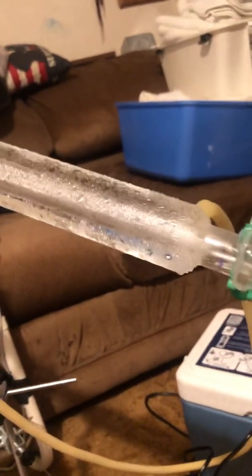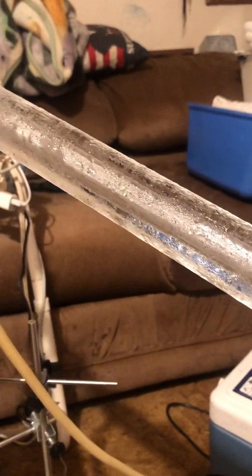This is what they call a Liebig condenser. It's basically a glass tube surrounded by another glass tube, encompassed in water, which basically just turns that steam — condenses it back into water.